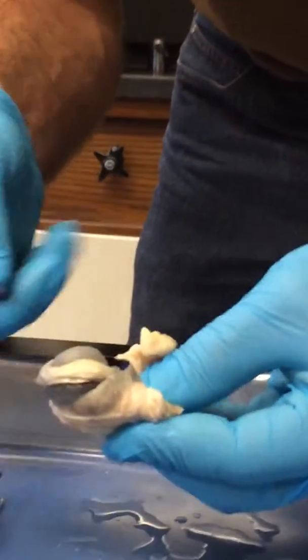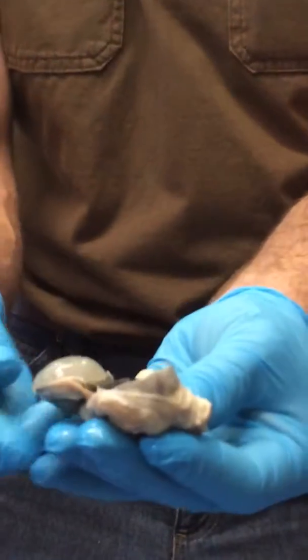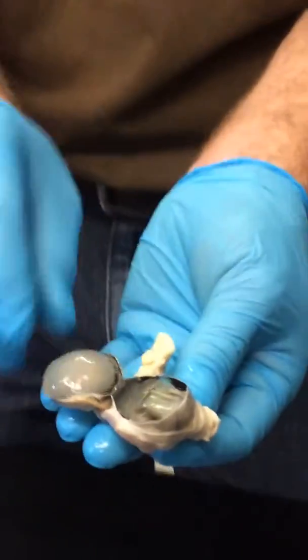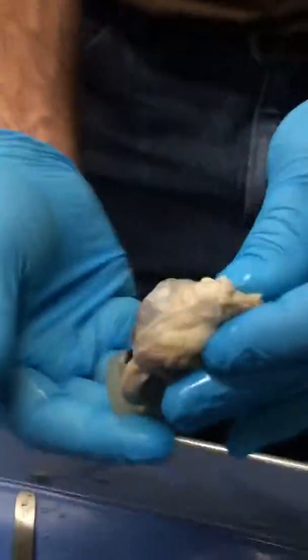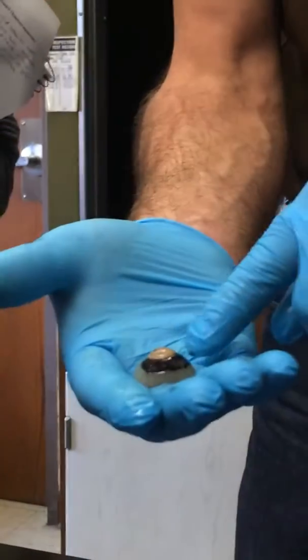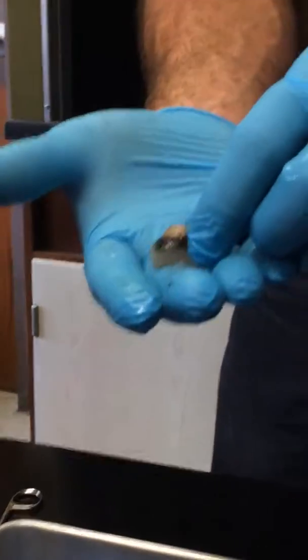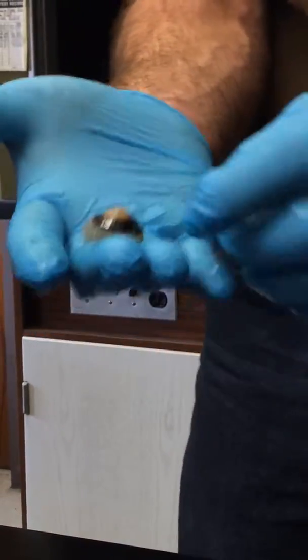Yay! The eyes have it. All right. So now if I open this up like a clamshell, we can see the vitreous humor here in all its glory. Okay? And if I flip that out of the sectioned eye now, lying on top of the vitreous humor is a good portion of the ciliary body, the iris there, and in the center of that is this opaque pellet, this little stone that is the lens, and it's really optically clear.